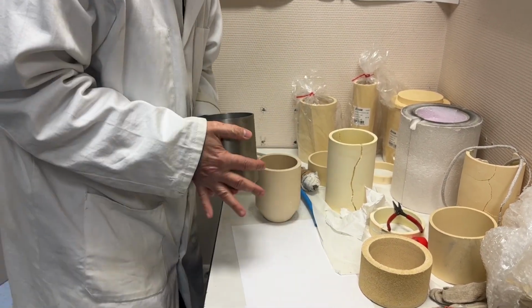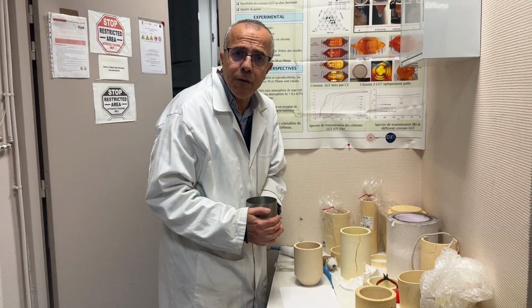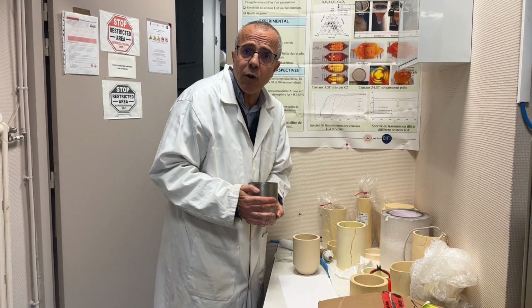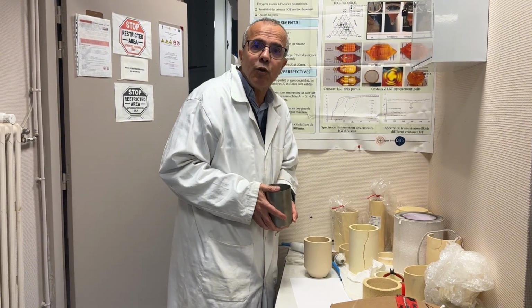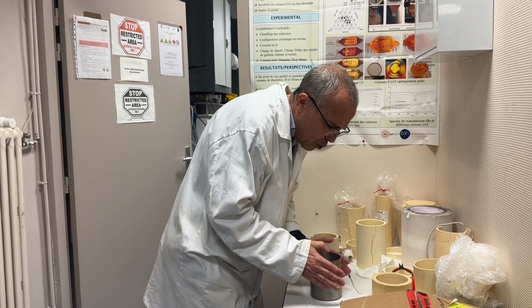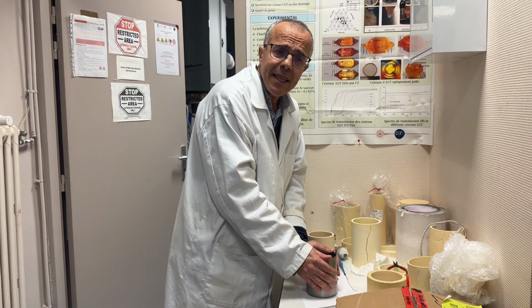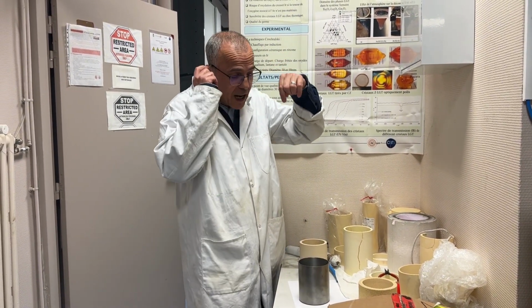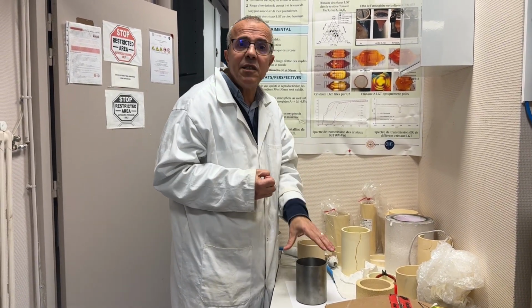But the most important is the crucible. As we are using an RF, radio frequency, heating source, the coupling to the RF crucible is necessary to control the coupling. So this is the most important thing for growing crystal. Then after that, I show you the crucible for growing by Czochralski. Then another important thing is the seed. The seed allows us to connect and to find the good orientation. So it is very important.